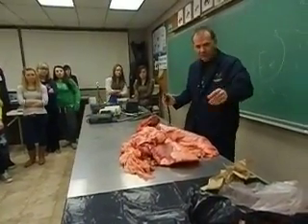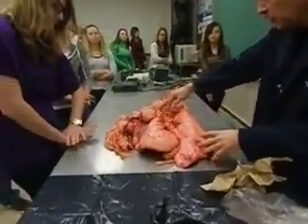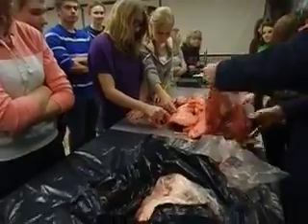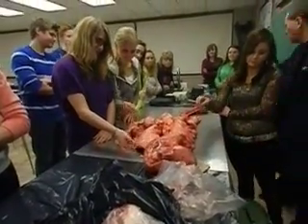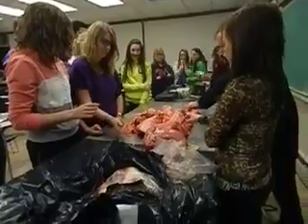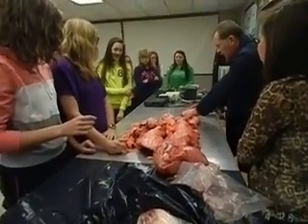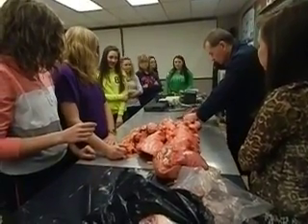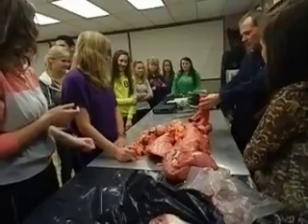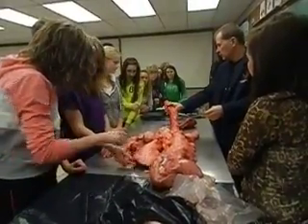I'm running low here — I want to save a little bit for the heart over here. There you go — you can kind of see how the lungs inflate and the whole bit. Feel free to give it a feel. That's what the sharpened end of the knife is. There's a cross-sectional diameter if you want to take a look at the trachea itself — really stiff, flexible.